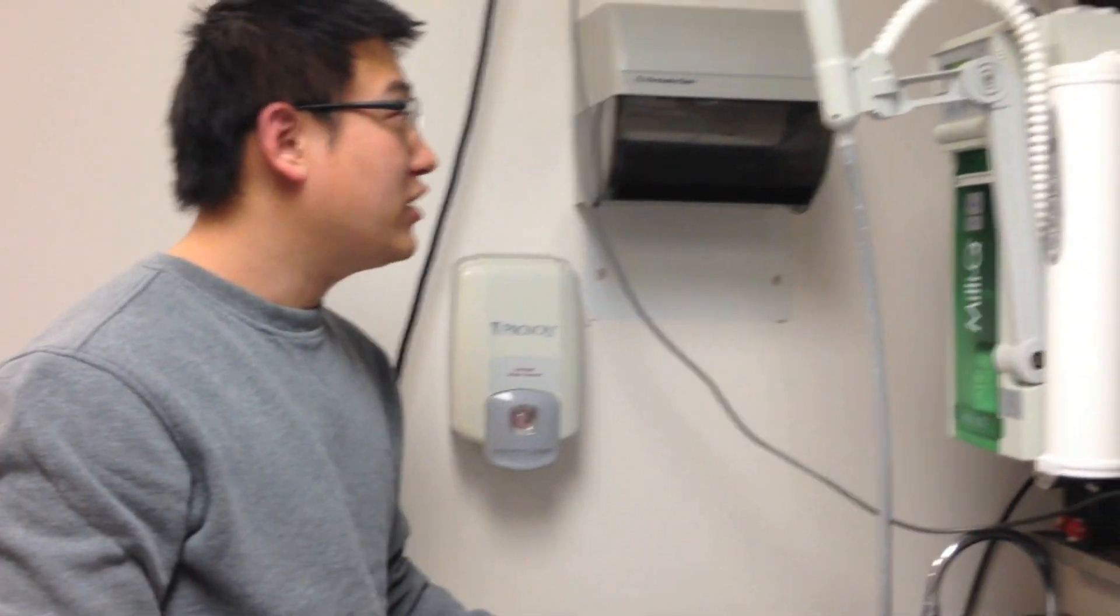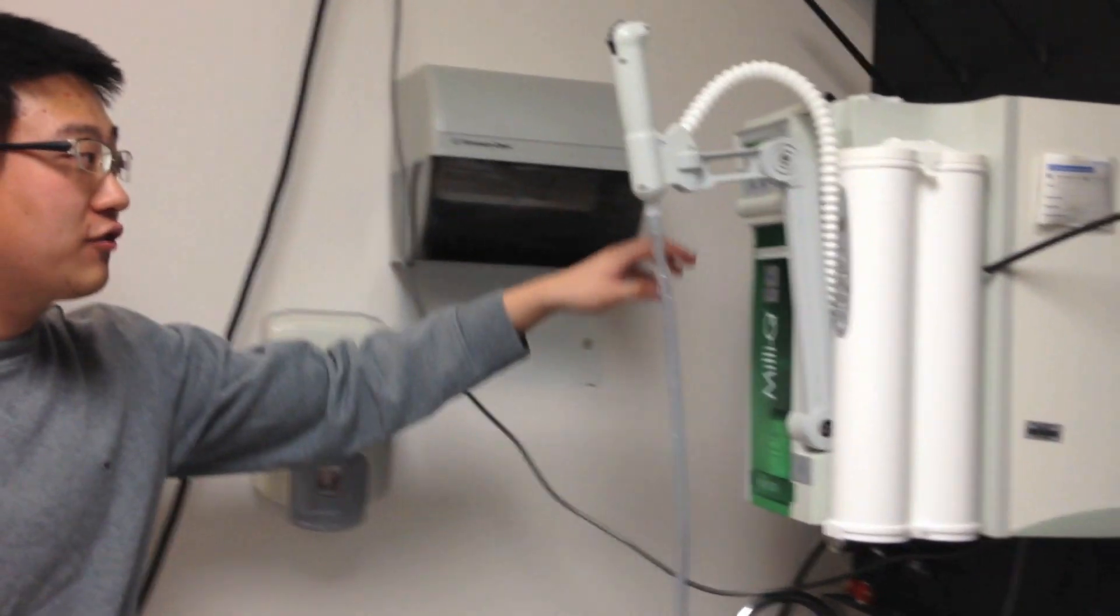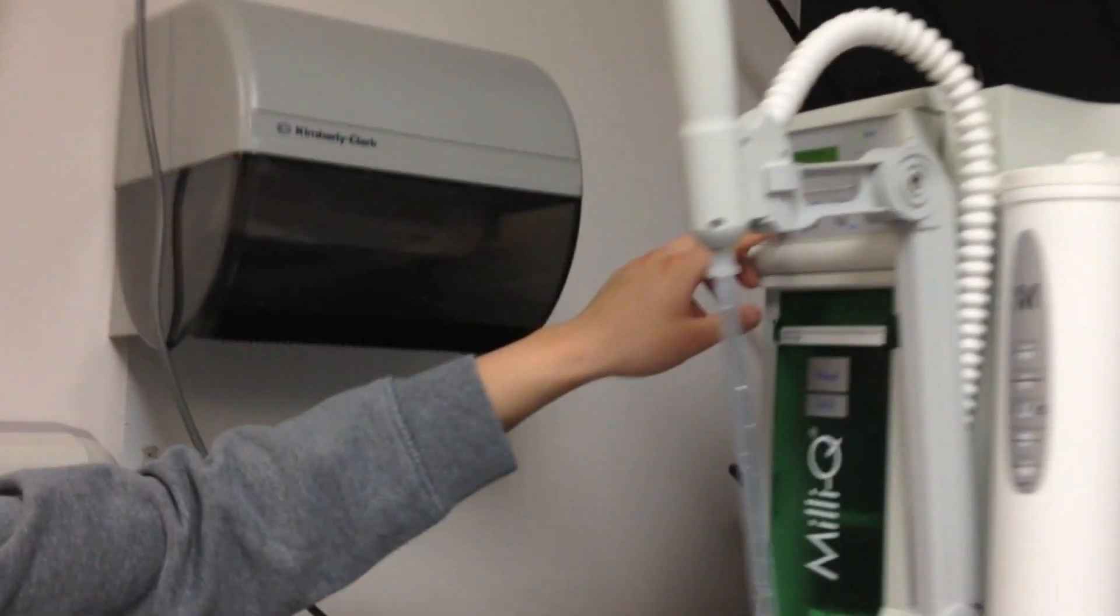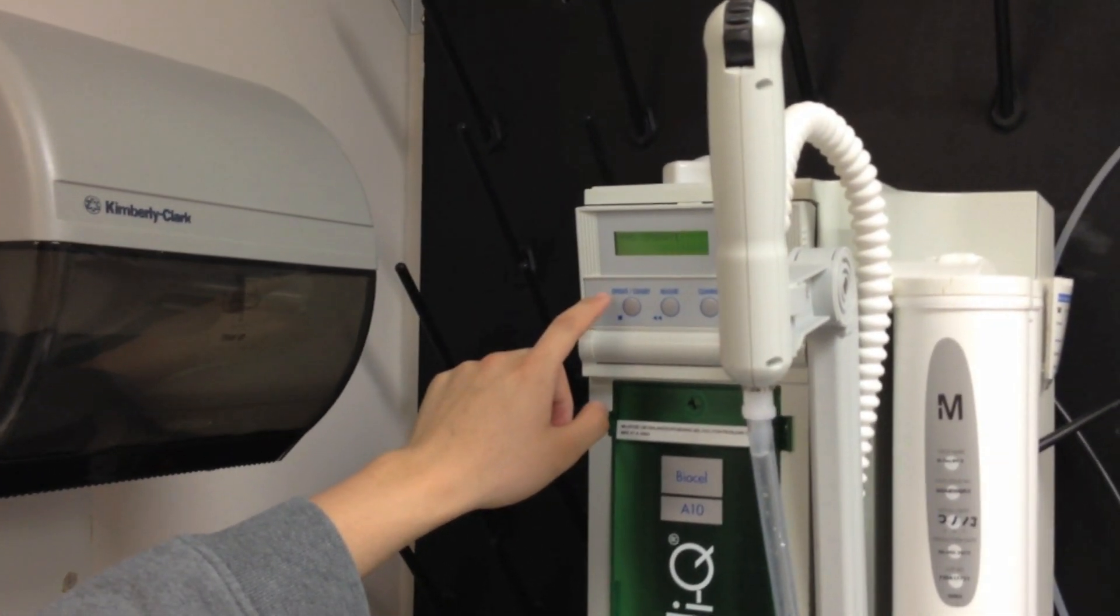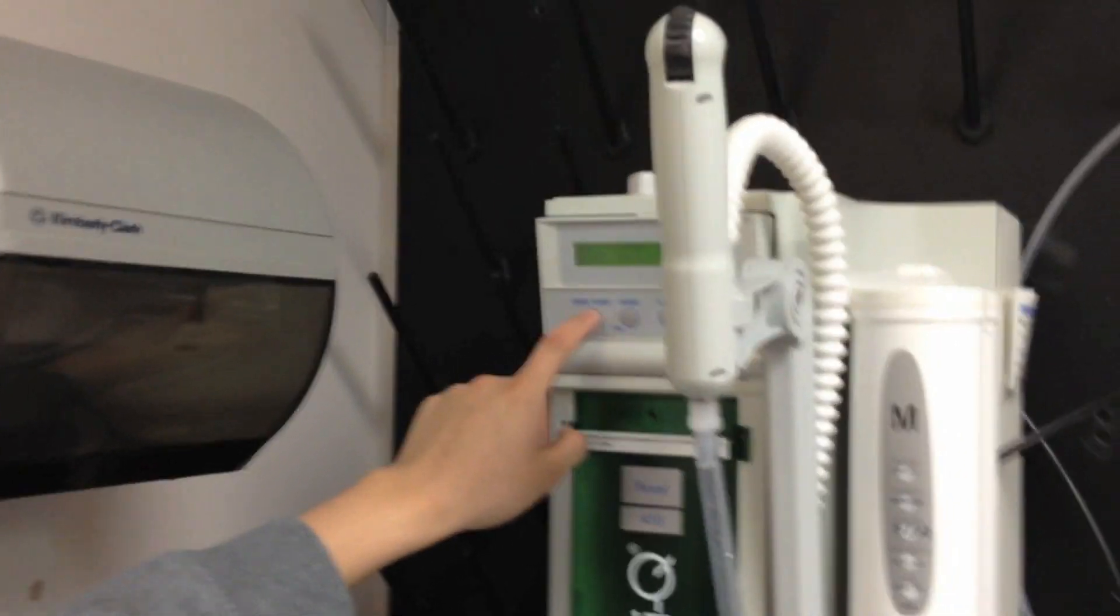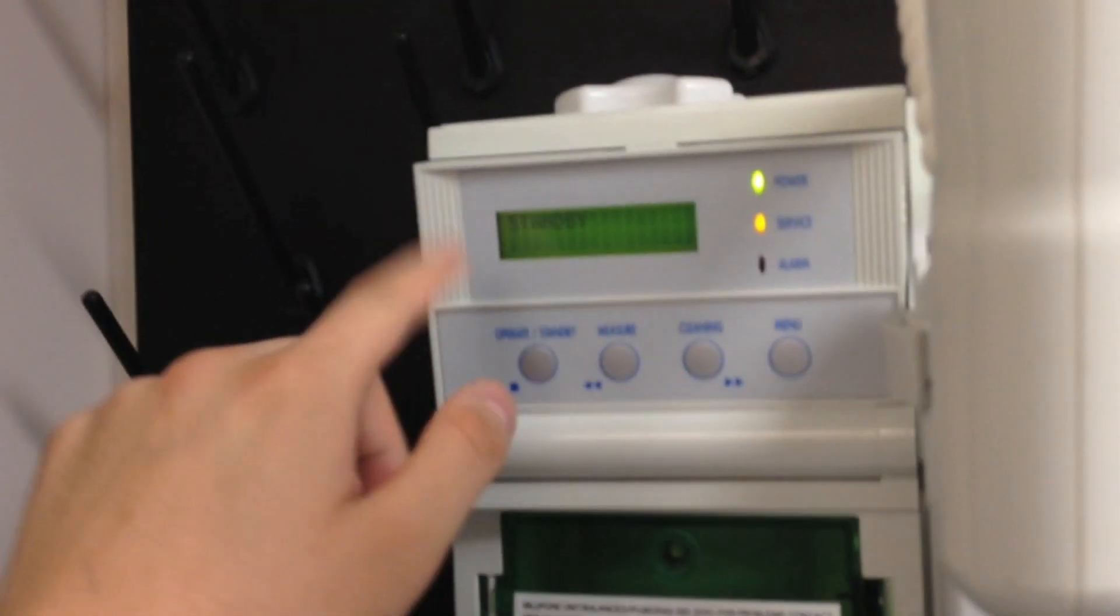Now for the sanitation, first you put the machine on the standby mode. Here, it becomes standby.